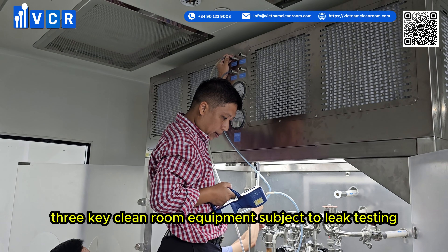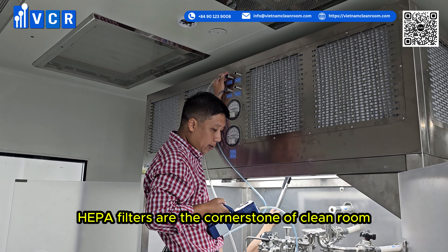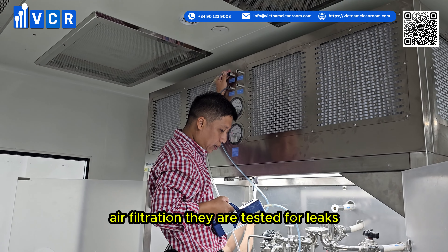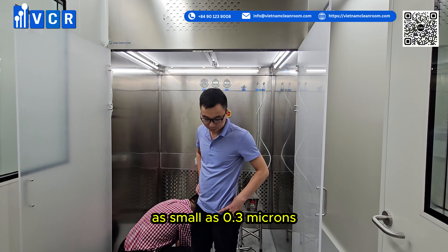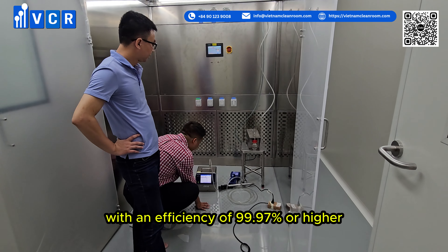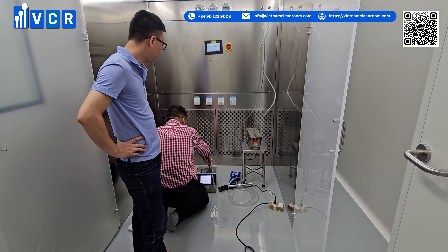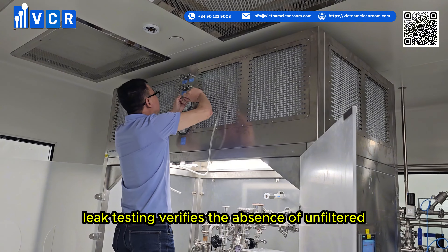3.1 HEPA Filters: HEPA filters are the cornerstone of clean room air filtration. They are tested for leaks to confirm their ability to capture particles as small as 0.3 microns with an efficiency of 99.97% or higher. 3.2 Laminar Airflow Units (LAFs): LAF systems ensure unidirectional airflow to maintain sterile working environments. Leak testing verifies the absence of unfiltered air ingress.